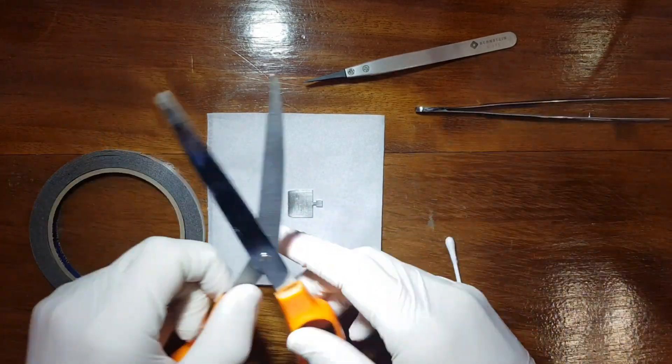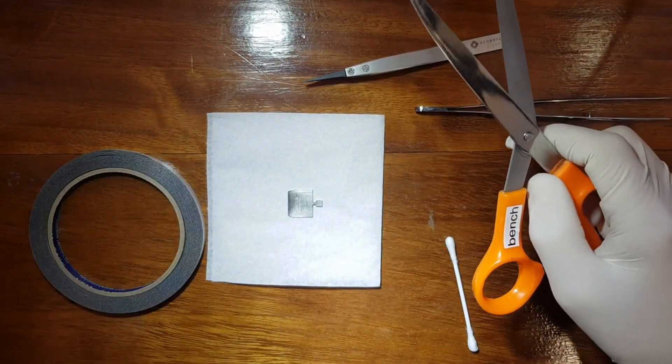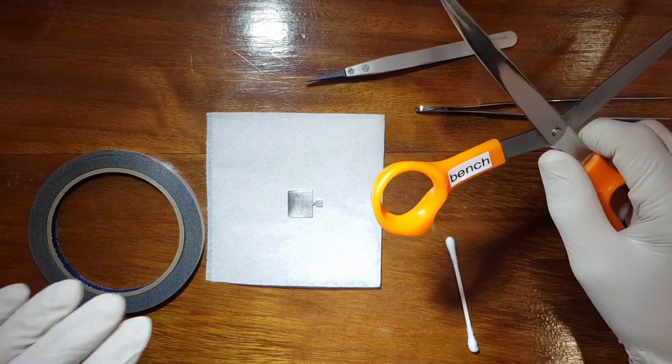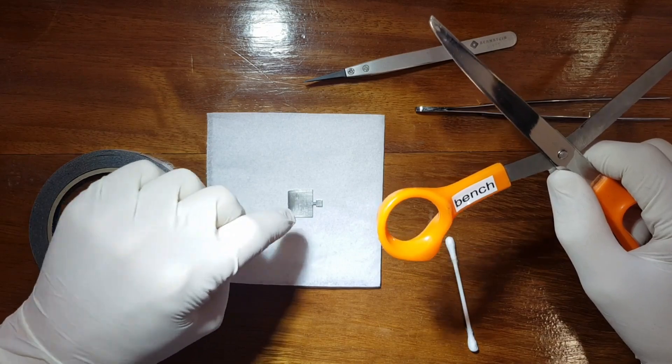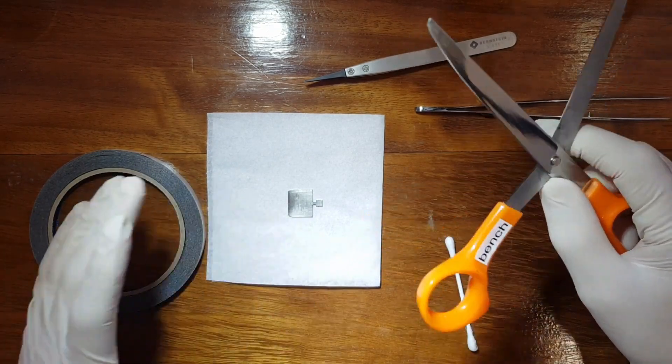It's also important once you pick out a sample, now these have been cleaned by myself, but obviously if you're working with people in the lab you have to keep a standard of cleaning your samples. You need to make sure every sample you pick out is visually clean.